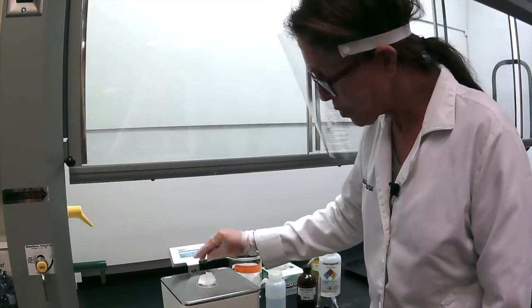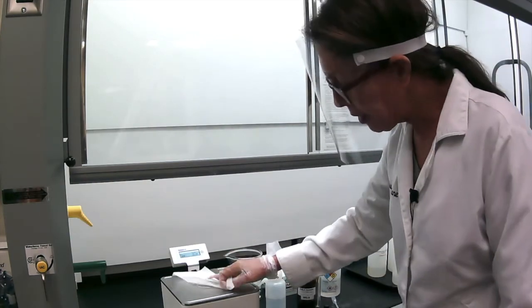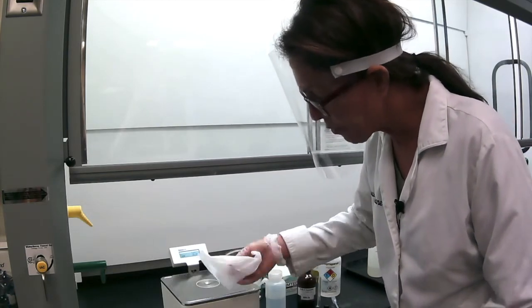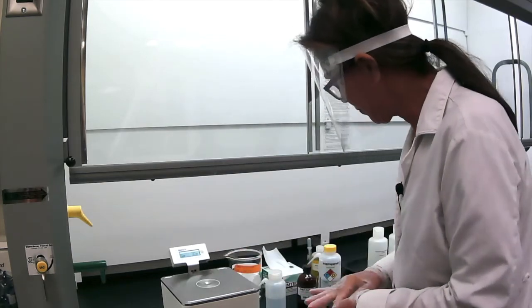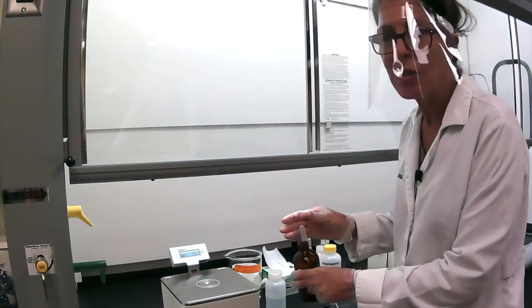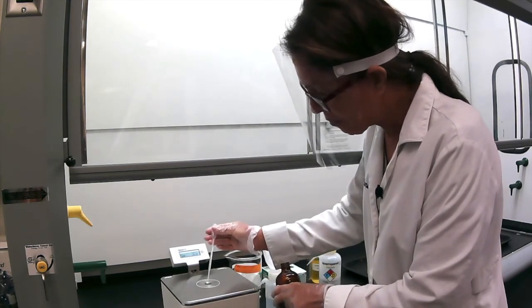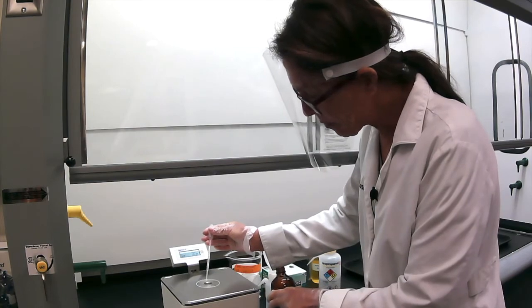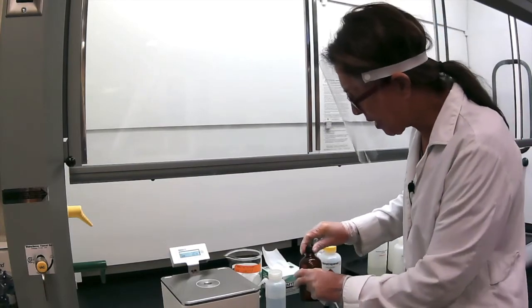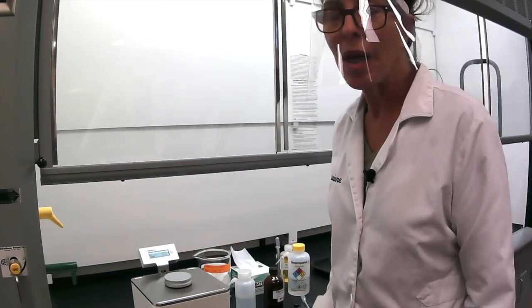So how do you do it? First of all, you remove all the water from the little hole here, and I'm going to clean it, make sure it's completely dry, and go gentle when you touch that surface. Once it's clean and dry, all you have to do is fill it up with your liquid. Like I did for water, I need to completely fill this hole to the brim. If you don't completely fill it, you might get a very bad reading. Then you cover, wait a few seconds, and just read.